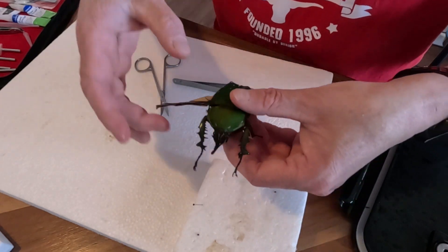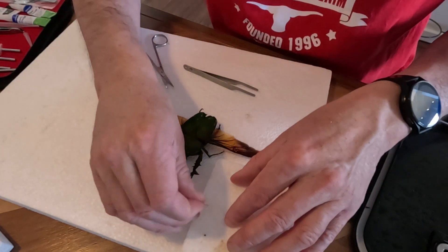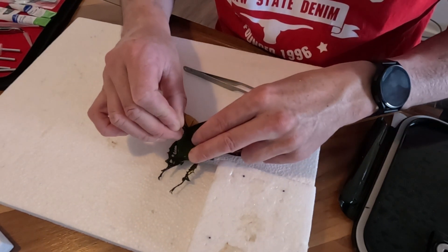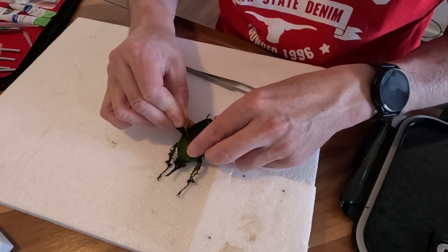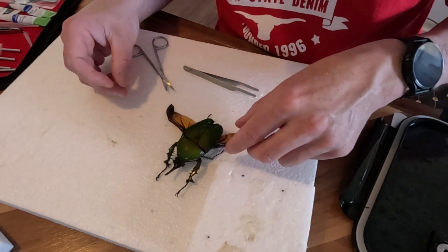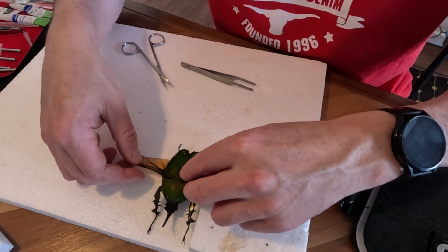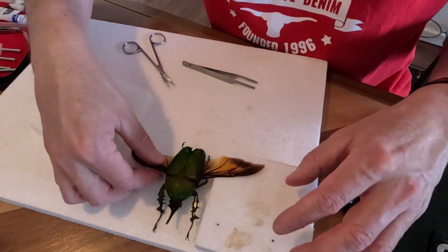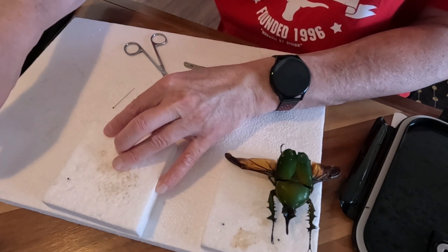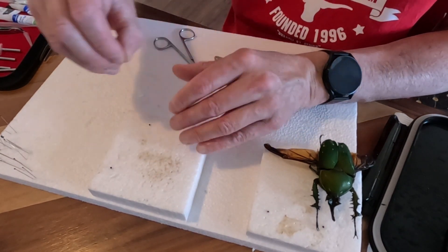Fold those wings out. Now that I've got that, I'll go in there and put this pin back in. Let's rethink this — spread this out. I'm also going to put this other piece of styrofoam there so we can put his wings and pin them over the top.